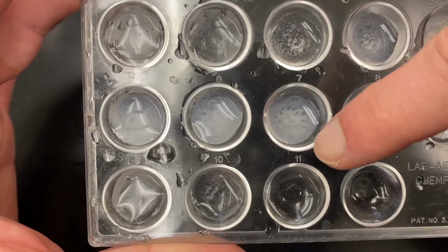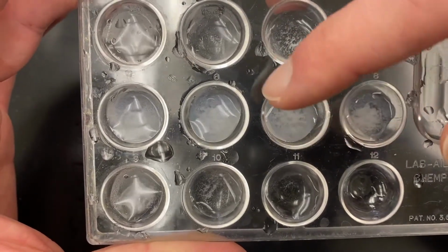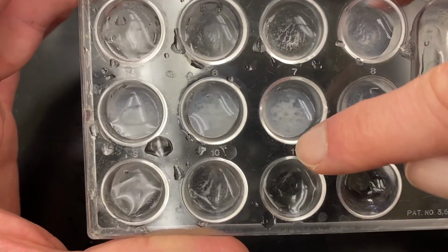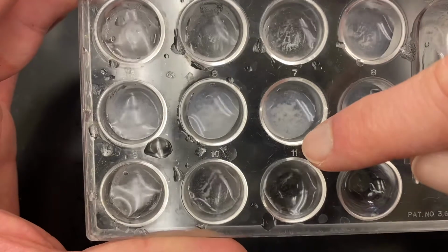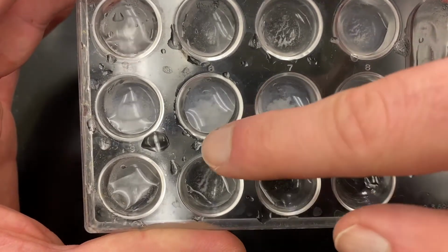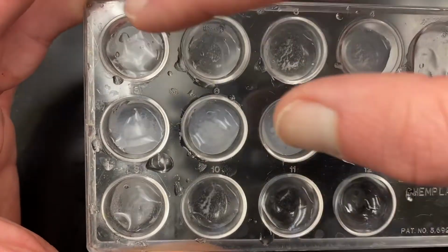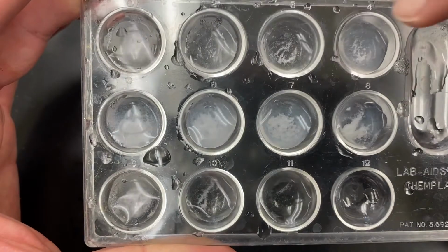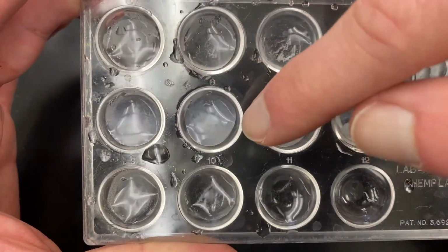And then if it's 7 drops of lead 2 nitrate, then it's going to be 11, 10, 9, 8, 7, 6, 5. So this is a 7-5 ratio. That looks like what our result's going to be, but it might be this one as well, which is 1, 2, 3, 4, 5, 6 to 11, 10, 9, 8, 7, 6, a 6-to-6 ratio.